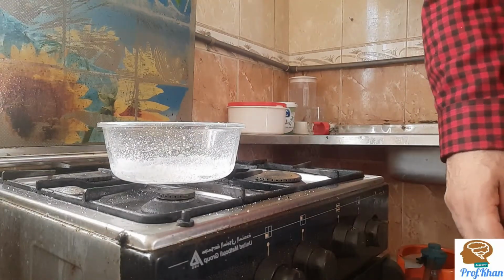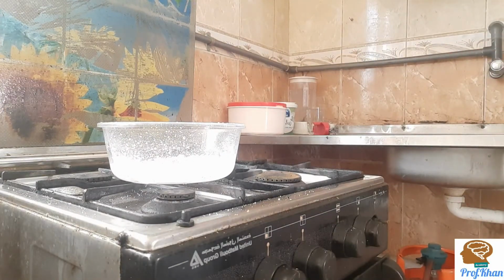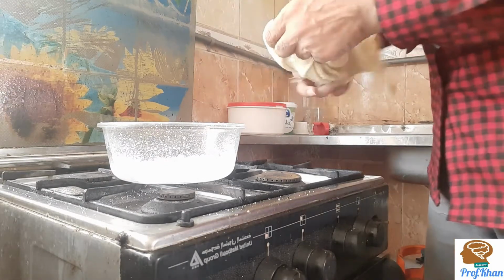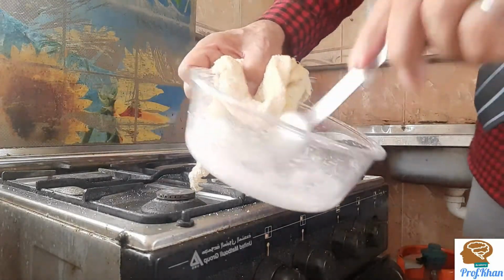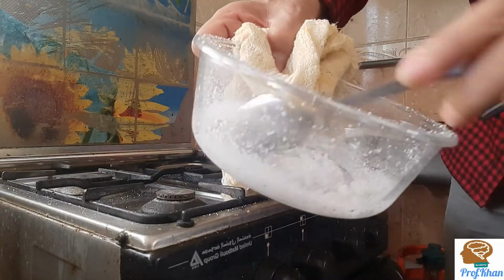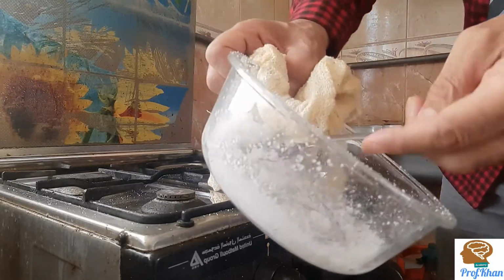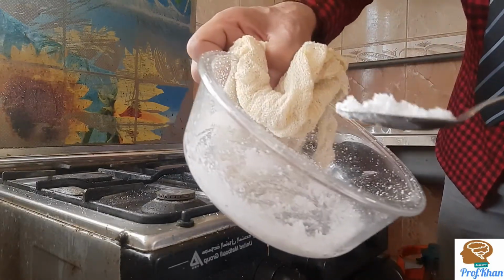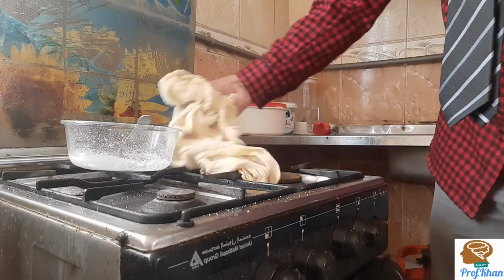so that I can show you the crystals of salt which are remaining there very carefully. It's risky. If heat is involved, safety must be observed, okay? Now, holding it carefully with a cloth, I would like to show you here. You can see the quantity of salt which I dissolved into the water and got back. And this is a simple physical change, not a chemical change, because very easily by the evaporation process you get back the salt.